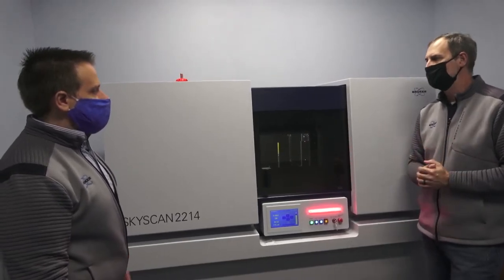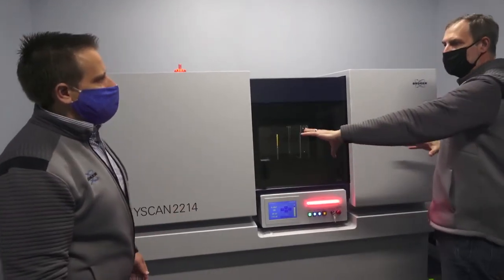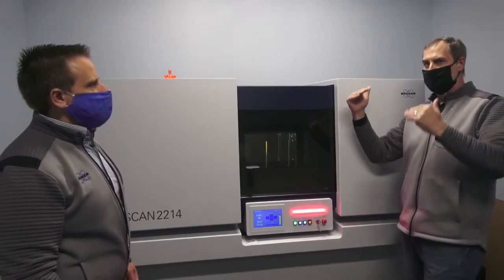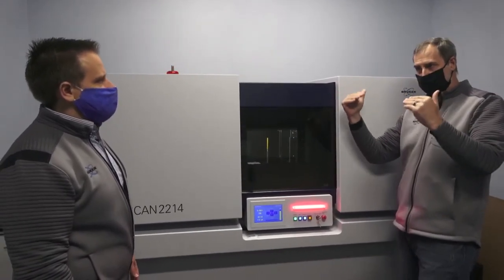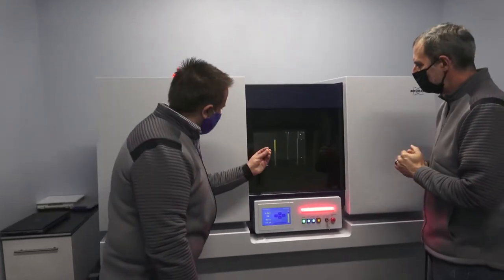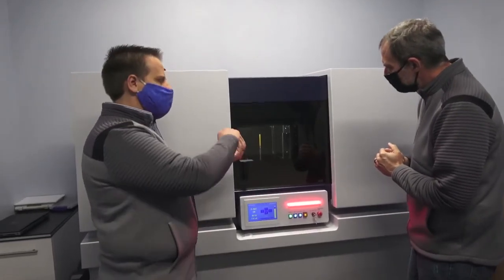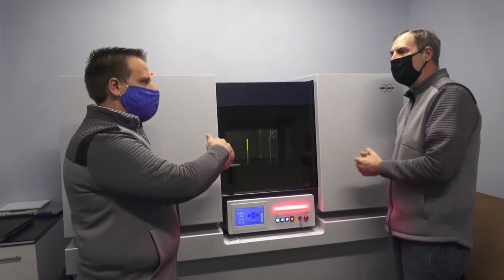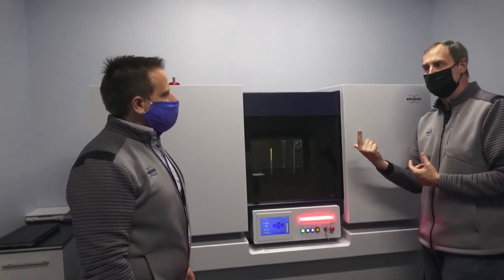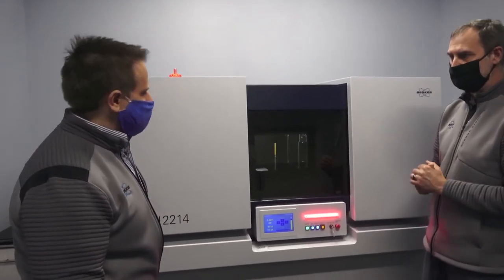The entire source and detector float together as one big unit. If your source and detector were not floated together, they would oscillate in different frequencies, and that would hurt your resolution. With the sample spinning during measurement, bearings can have some wiggle. Again, this uses an air bearing — the rotational stage is floated as well to minimize vibration and make the rotation smooth.